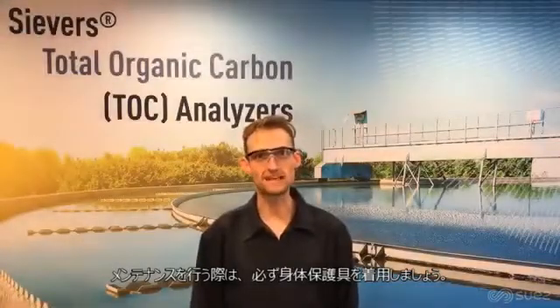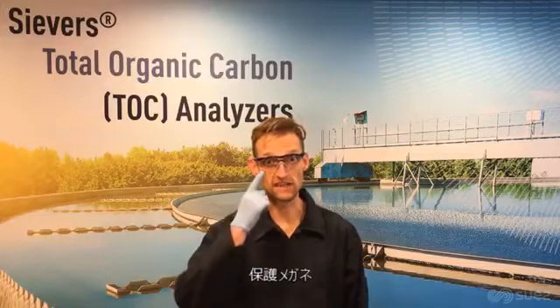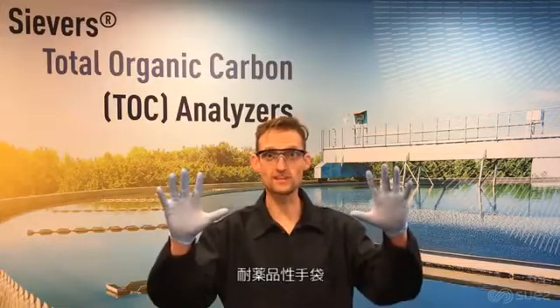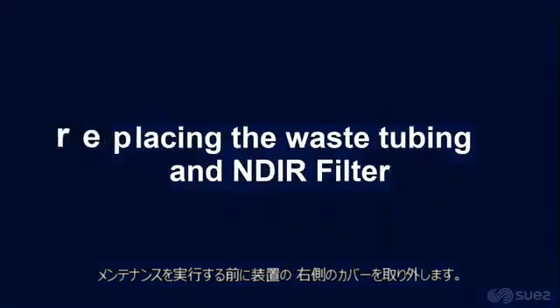Anytime we're performing maintenance on an InnovOx, we should always take safety precautions. That means wearing safety glasses, chemical-resistant gloves, and of course, a lab coat. Before performing maintenance on the analyzer, remove the fluidics cover.